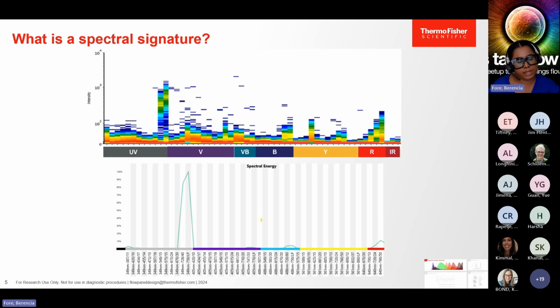So now I would like to bring your attention to the bottom of the illustration where you see this reddish shaded area. This is the autofluorescence from the cells or the beads that were stained with BUV 737. It's important to note that a single color control, when run on the instrument, contains both the fluorophore emission and the autofluorescence of whatever particle you're using. They're both present in the tube.